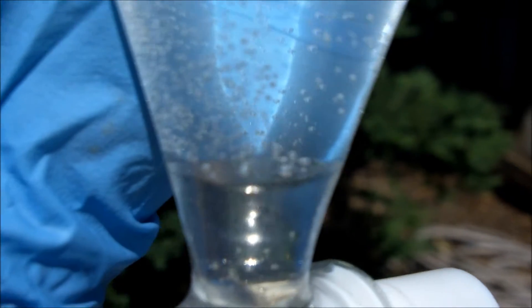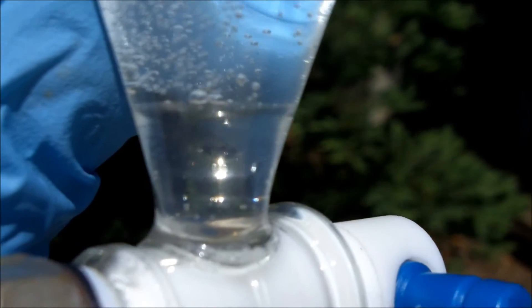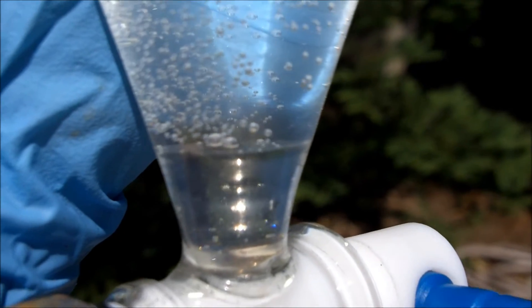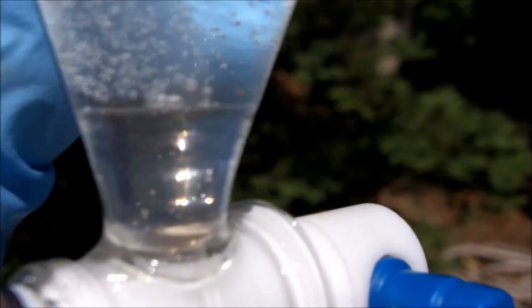I let my bromoform solution stand for about 15 minutes and added it to the sep funnel. And as you can see, there's clear phase level separation, and I know that's bromoform on the bottom. However, I didn't get very much. I'd imagine if I would let this stand for even longer, I could get more of it to come out of the solution.